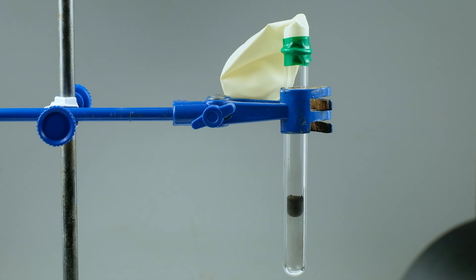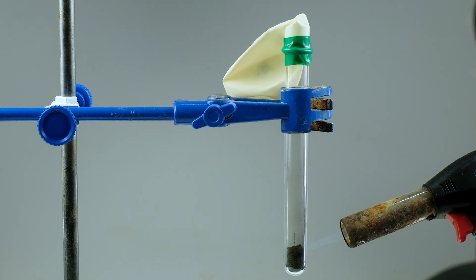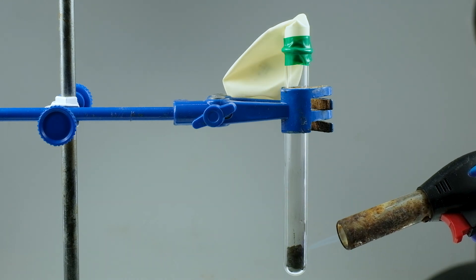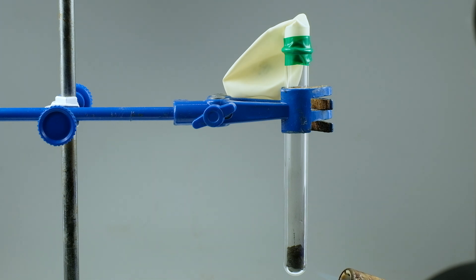Now nothing prevents the release of hydrogen, and we can observe the balloon's volume changing.